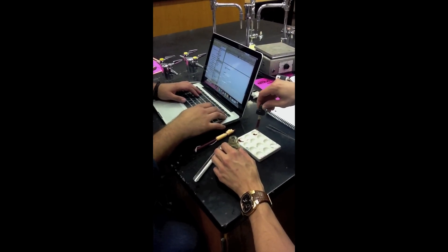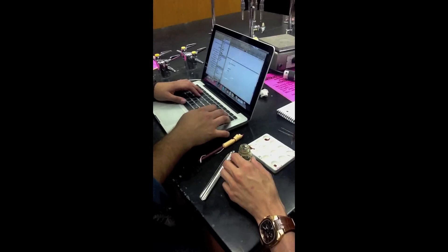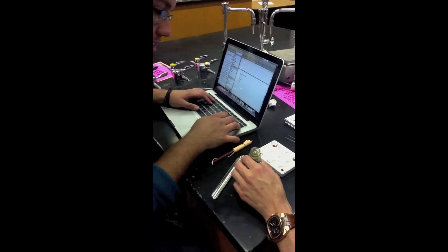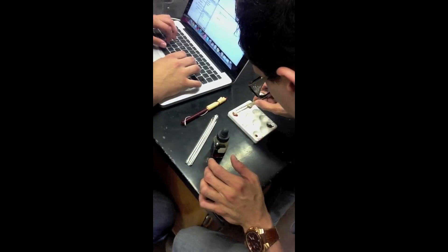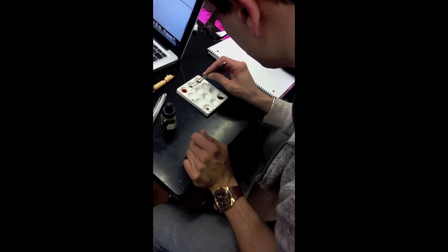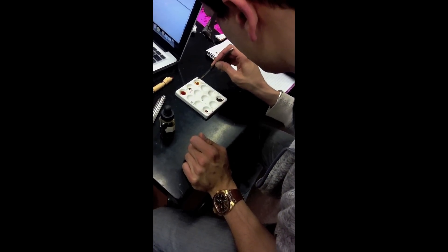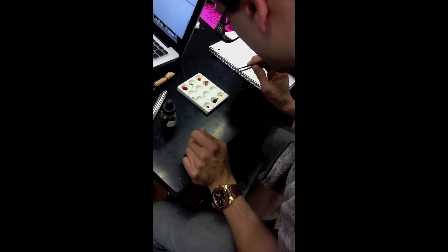So we've covered that. Let me see if it's turning on at all. Yeah, that looks like a change. So now we have to move to a clean depression. Let's start off with cotton — move it to the clean depression — and then I will write our observations. That was a definite change; it absorbed everything.